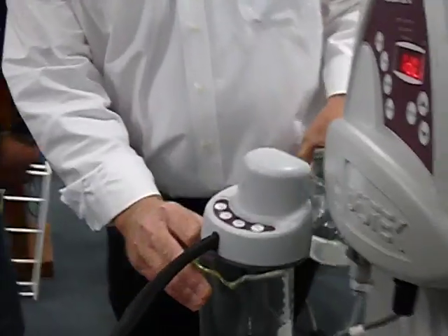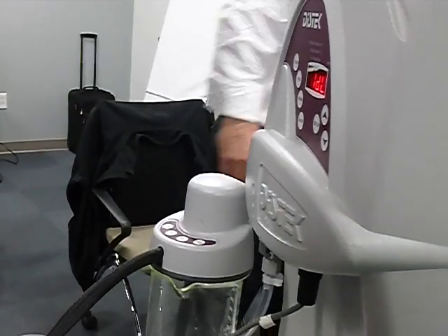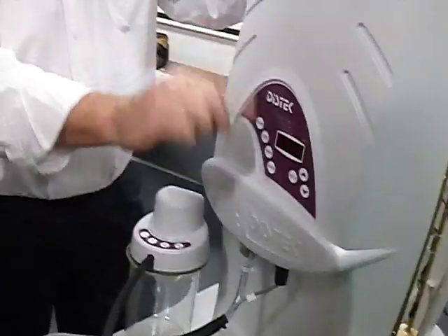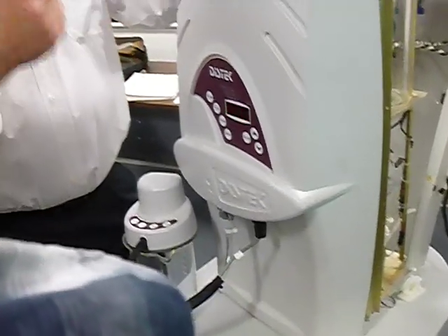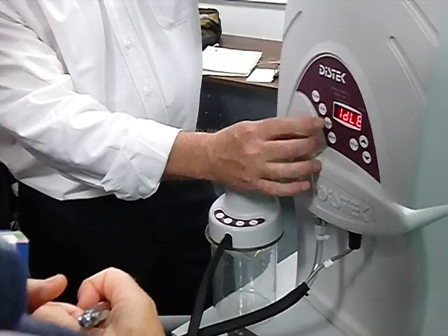All right, now we'll try this again. We're gonna run 500. We're gonna do a setup, okay? Setup, we're gonna run 500. 37 degrees C. We're gonna only use one vessel. You can do one or two, anything up to 1,000. You can do 4 250s, 2 500s, 1 900, 1 1,000. Okay, and we're gonna run it.